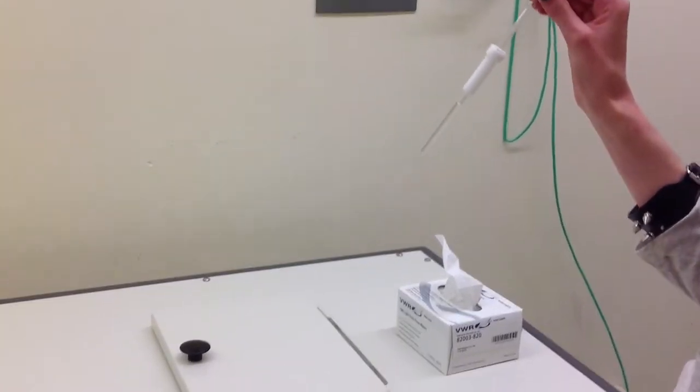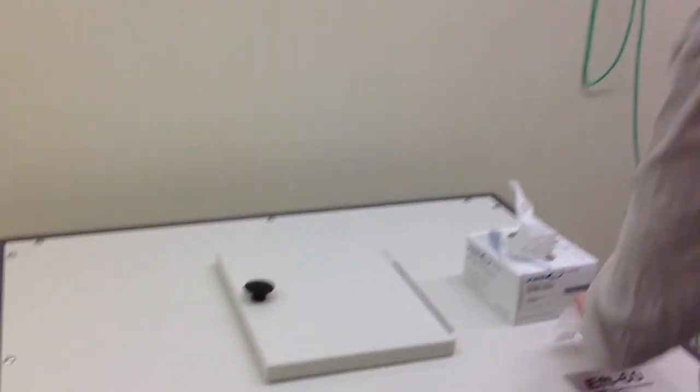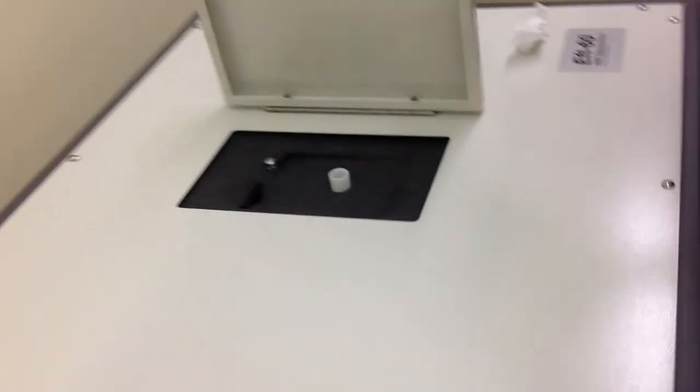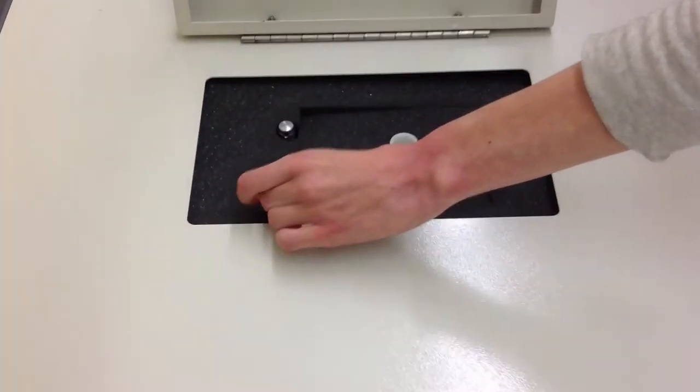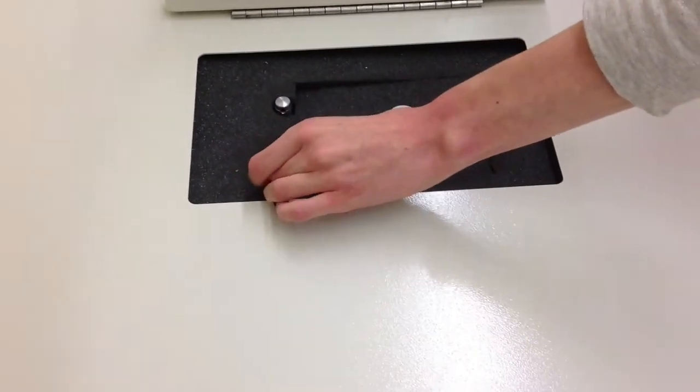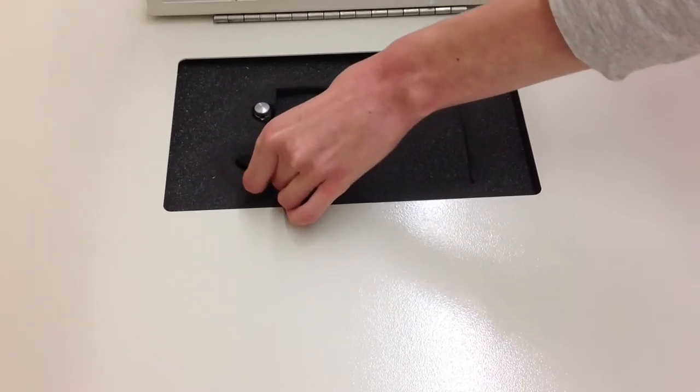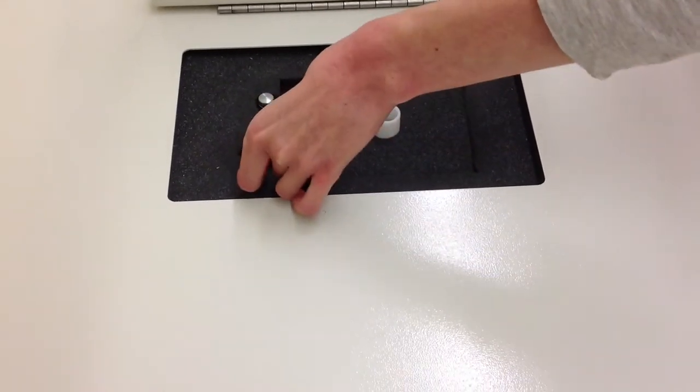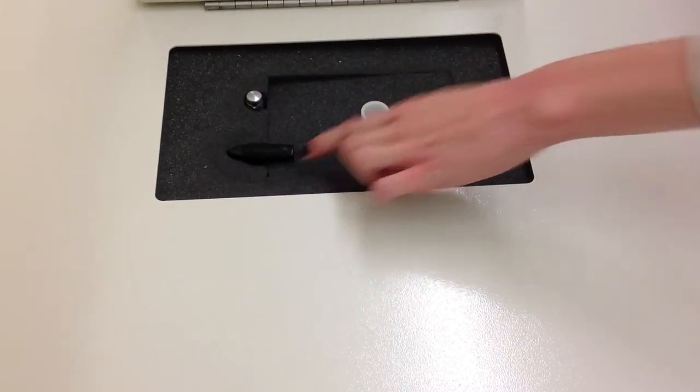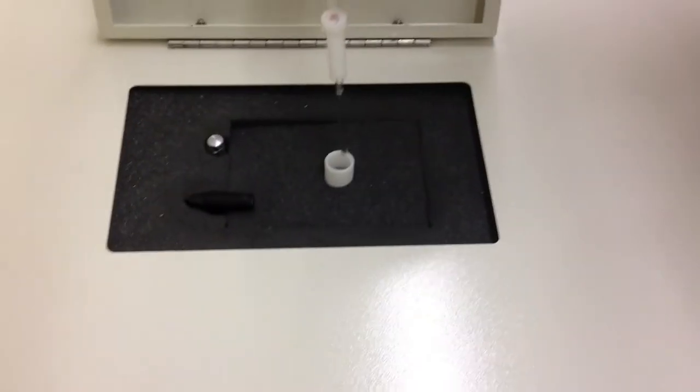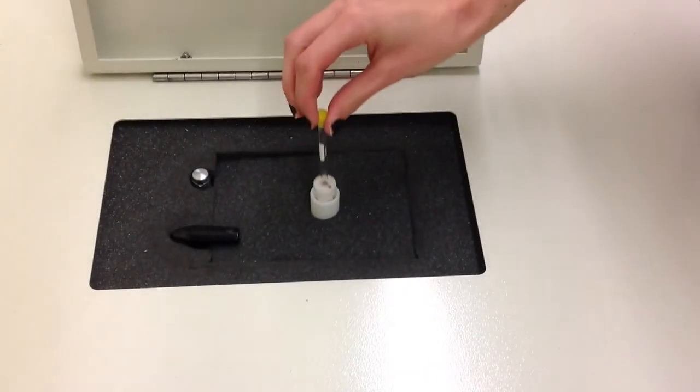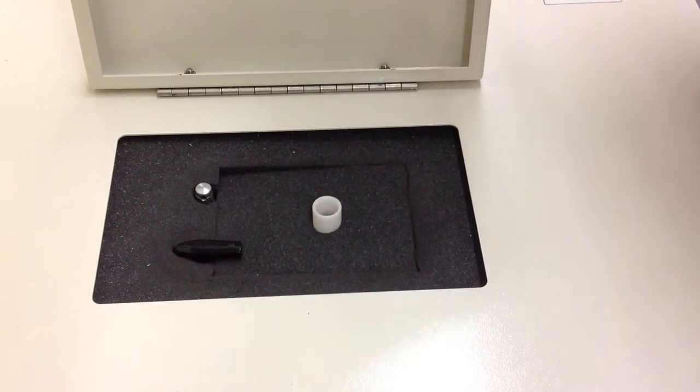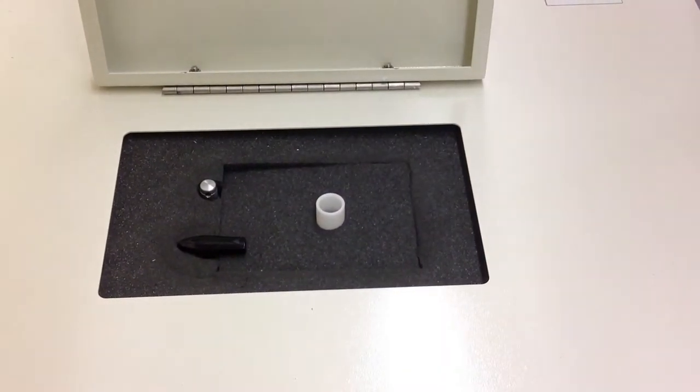Now you're ready to put your sample in the compartment. I'll lift up the door and then I'll turn the air on spinner, and by putting the dial down I will drop the tube down below.